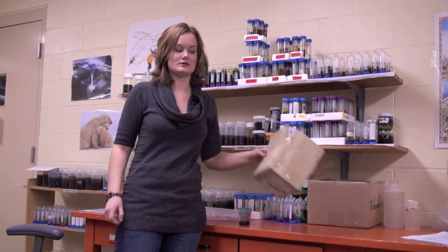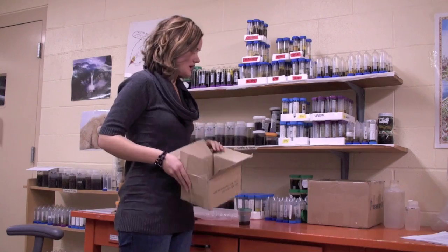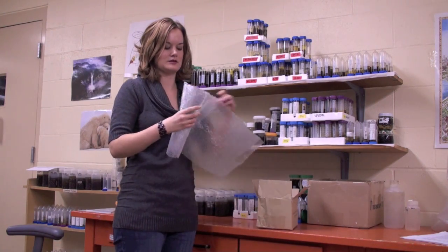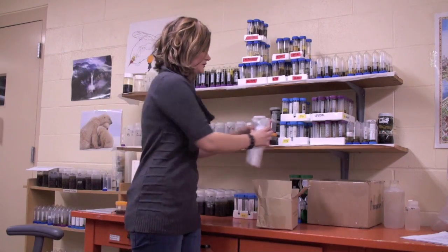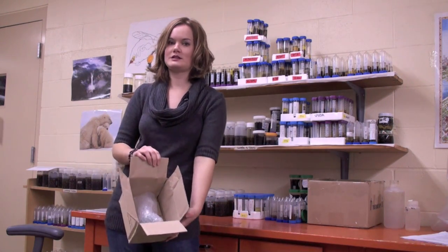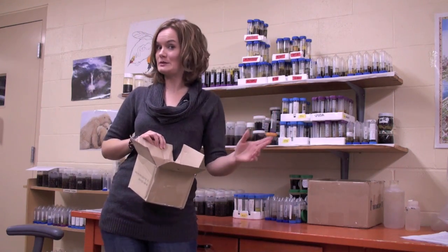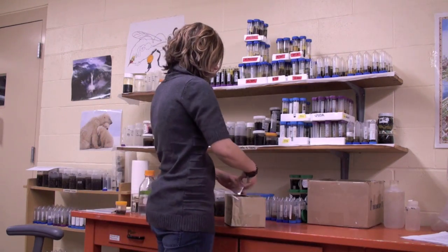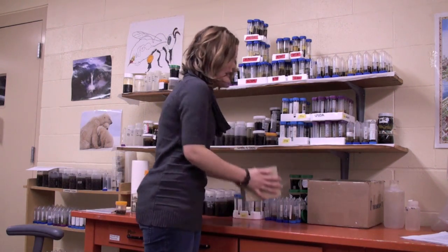So we went over the registration form, what to put the sample in, and how to pack it. Now I'm going to show you what I need you to send it in. You can send it in a padded envelope if it's one or two samples; otherwise, use a box — this little box is a good example. Here we have your sample reinforced with wax paper, and so the sample isn't rocking around in the mail, we wrap it in bubble wrap and stick it in the box. You can use packing peanuts, newspaper, or whatever you have available. Then shut the box, grab some packing tape, put an address on it, and I have your sample.